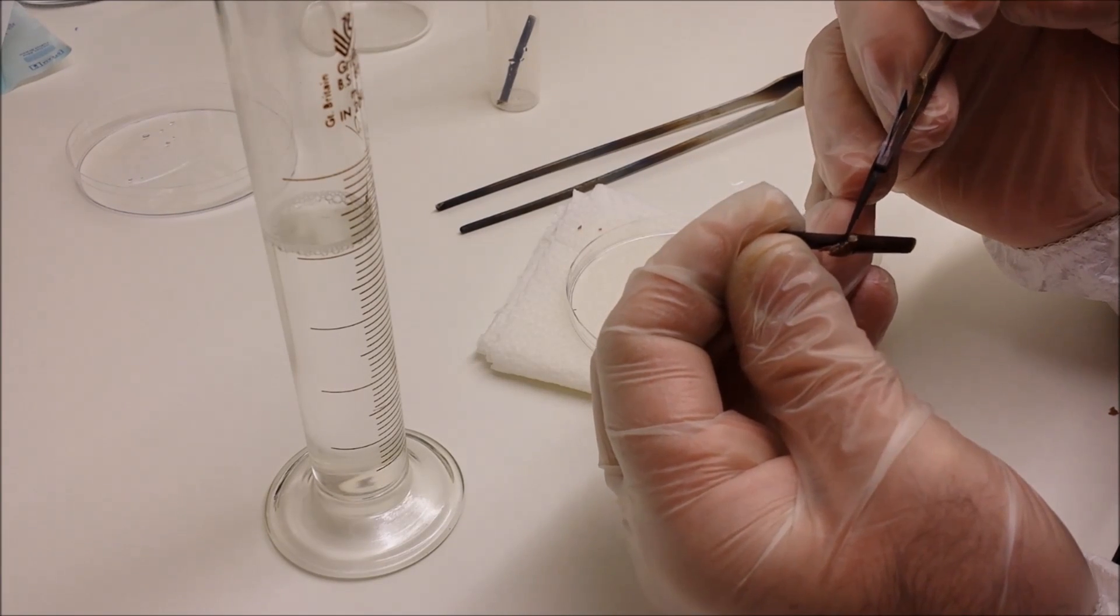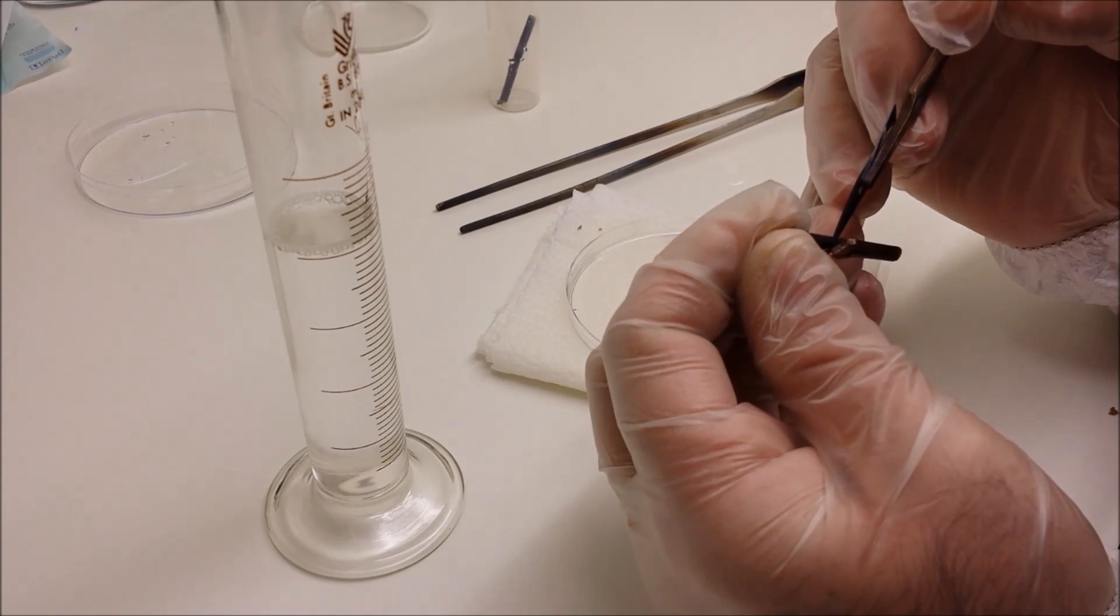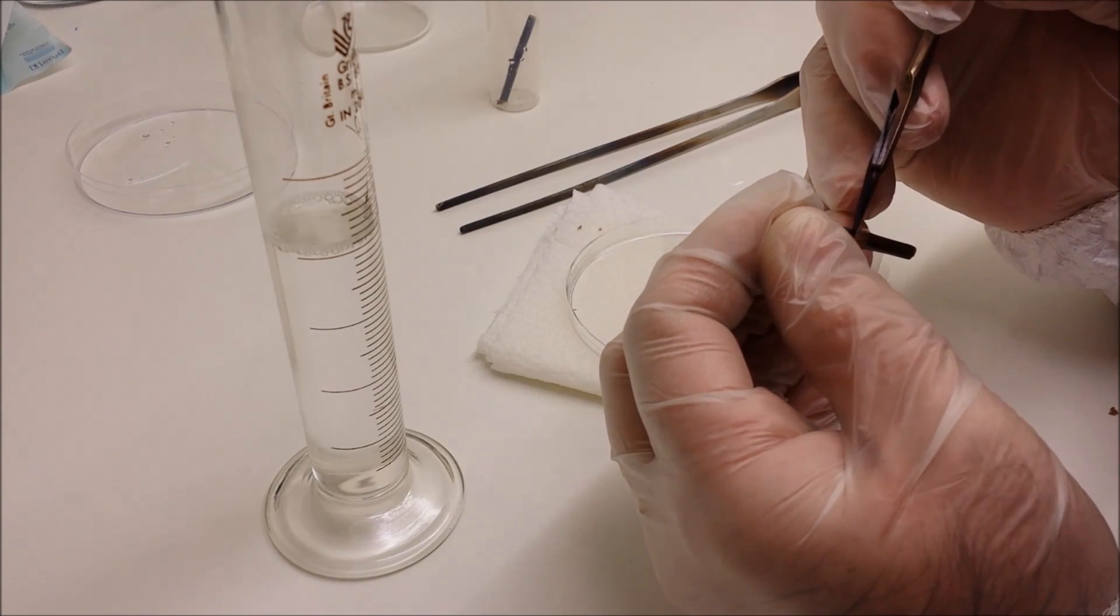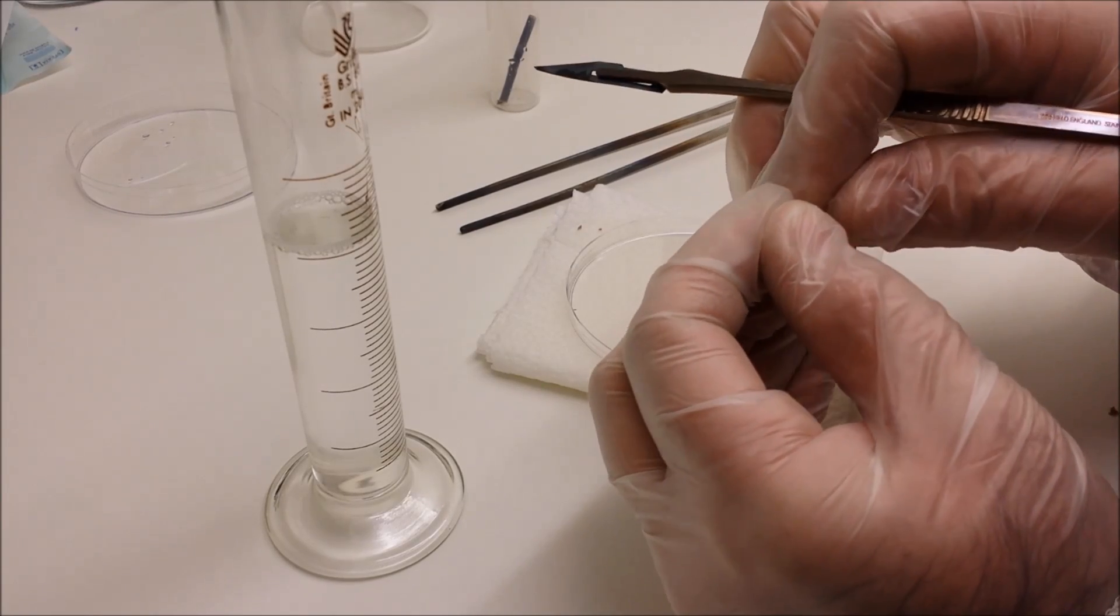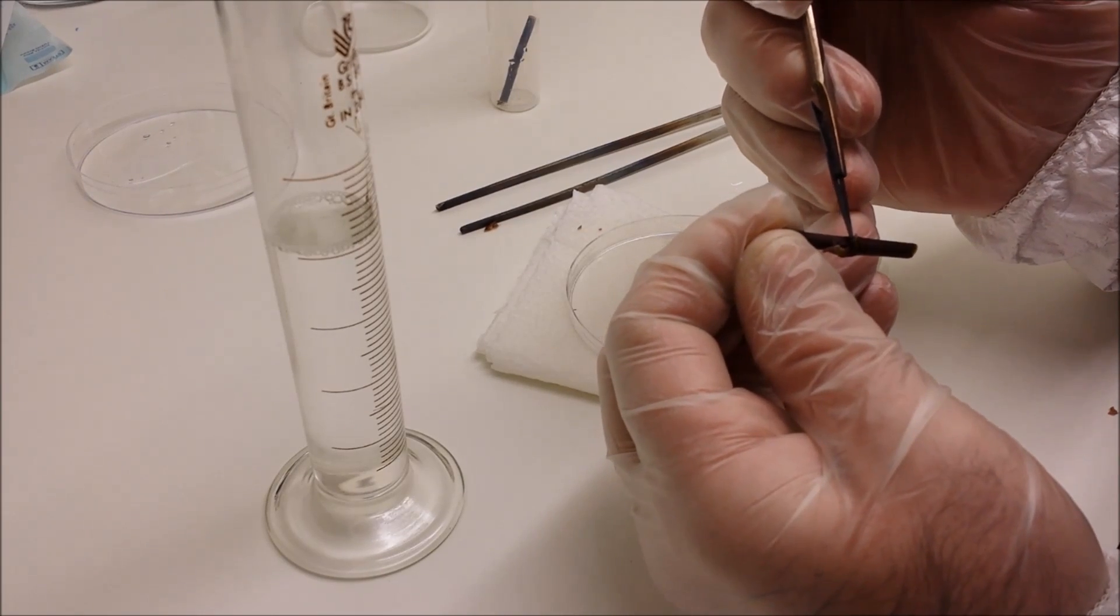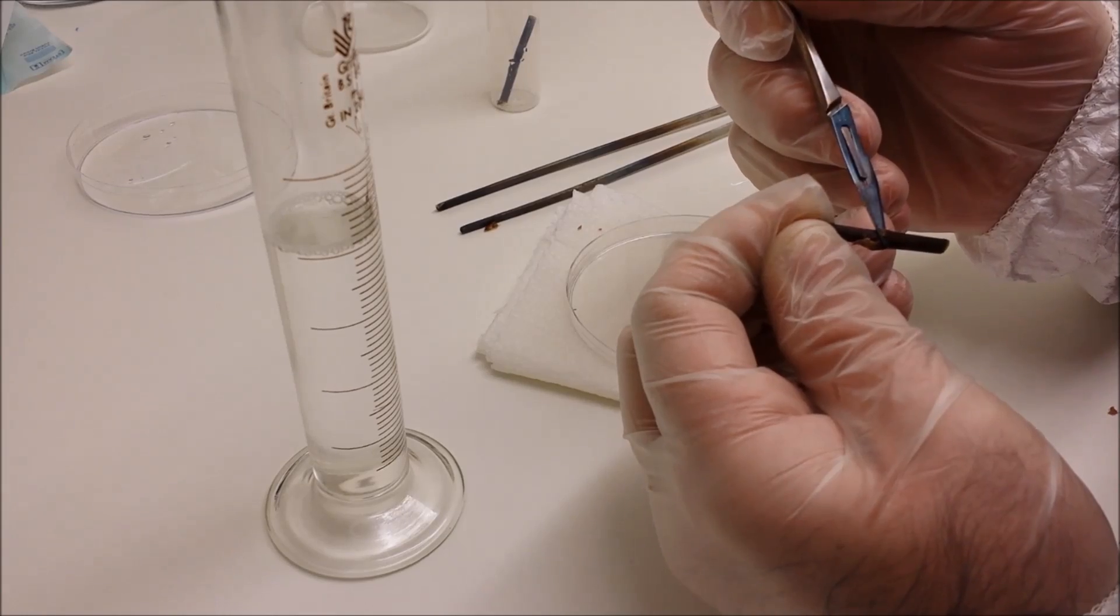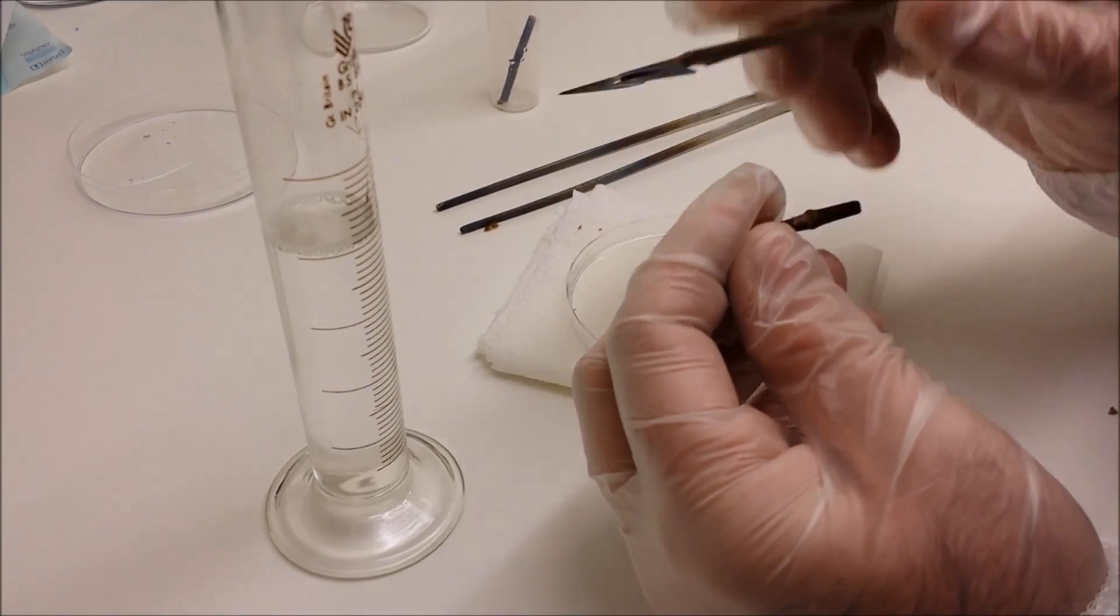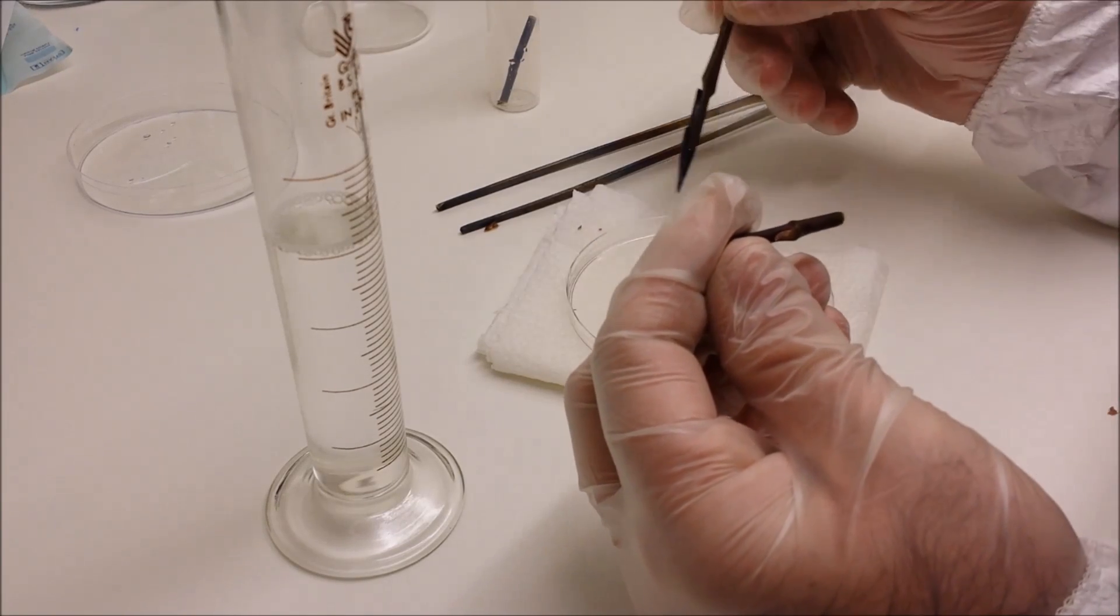So we're coming up to the second one now. Hopefully you can see the bud that I'm trying to uncover, although it is a little bit dark because of the lighting in the box, but I'm sure you're getting the idea of it. So gently scrape away.